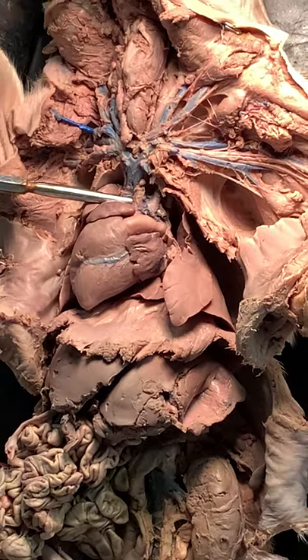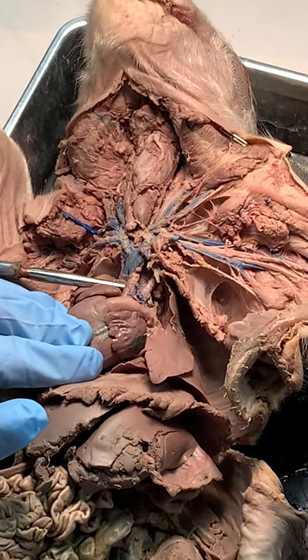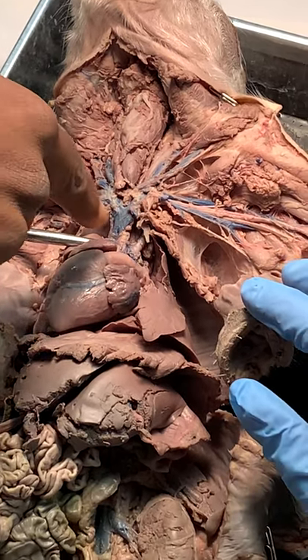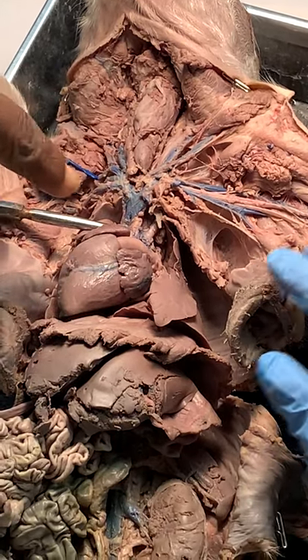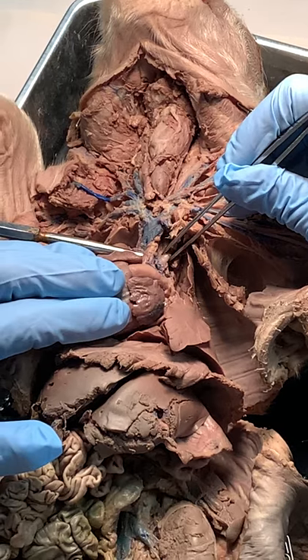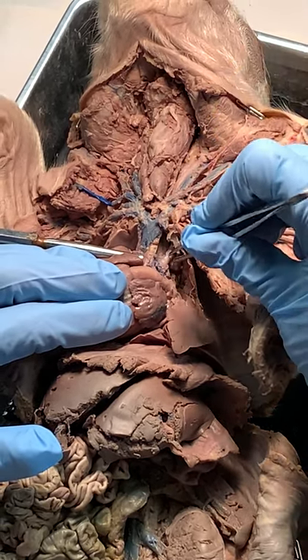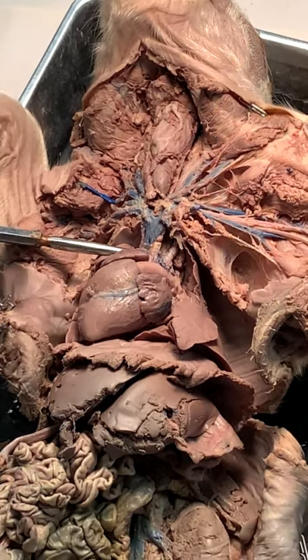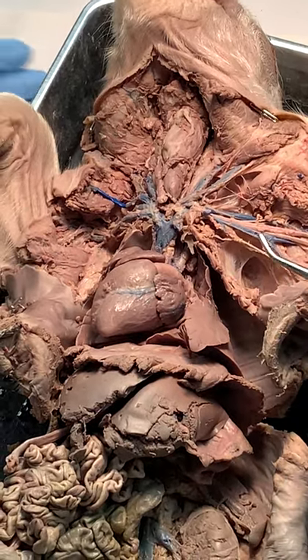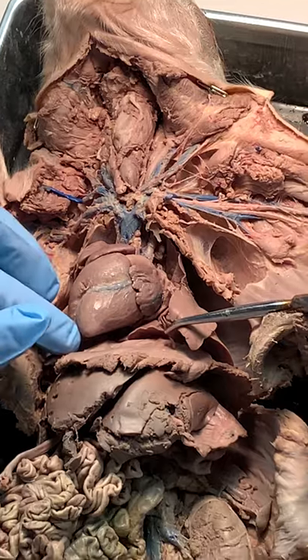So those two — the left subclavian and the brachiocephalic trunk. This one will go out to the arm. Let's do the veins first because they're on top, or the most superficial.